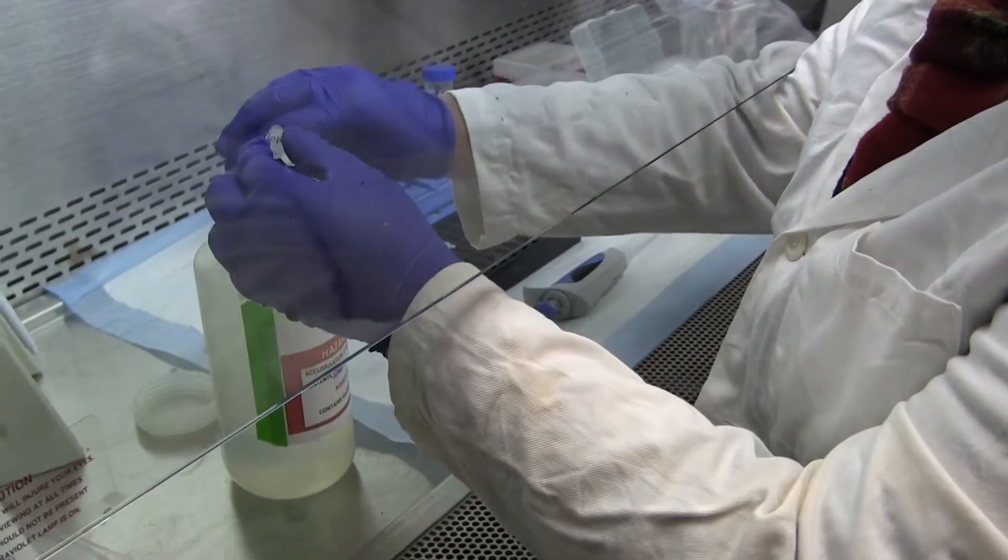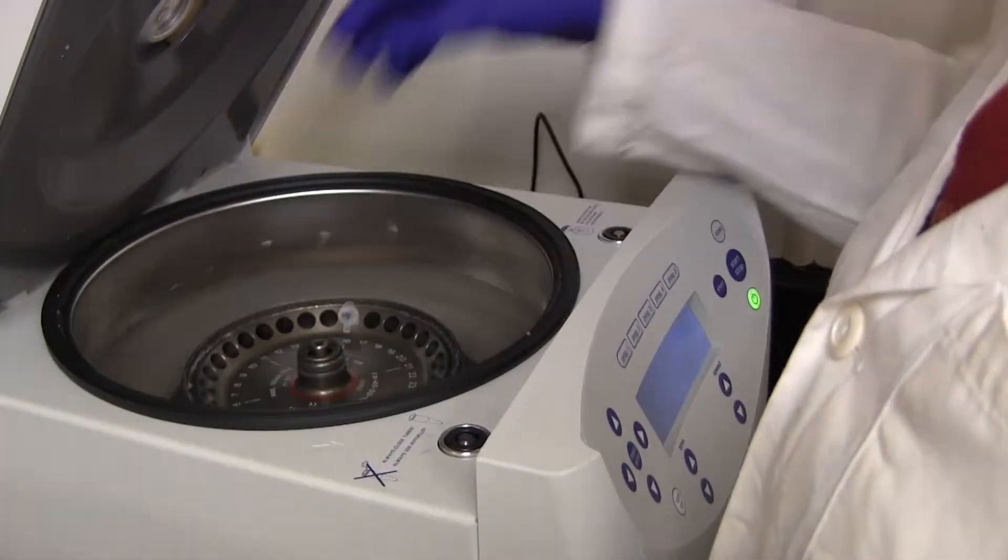So now we're about to dump again, and then the very important step of dry spinning.